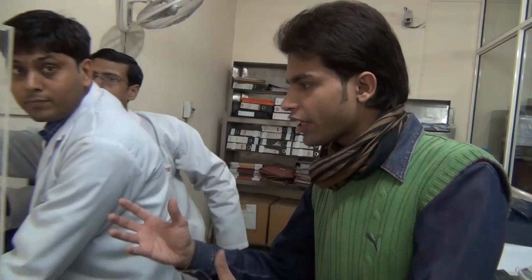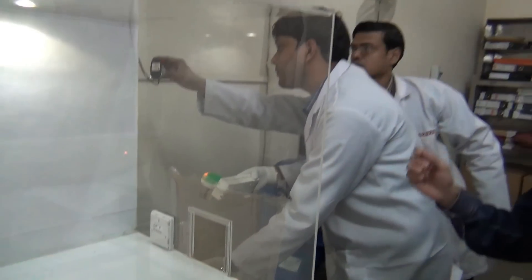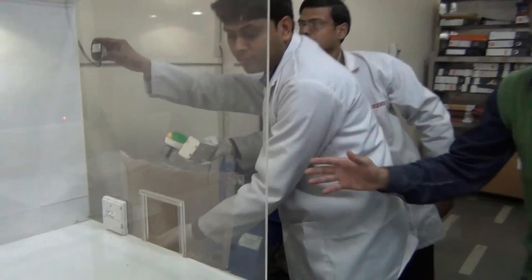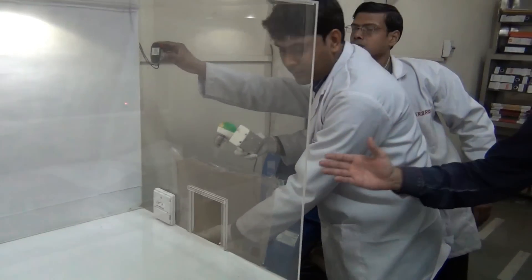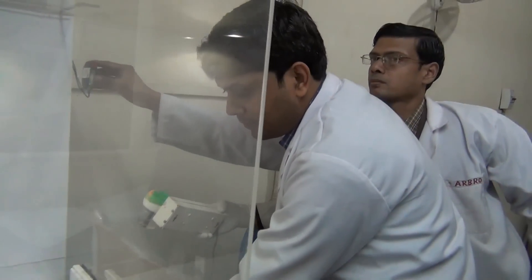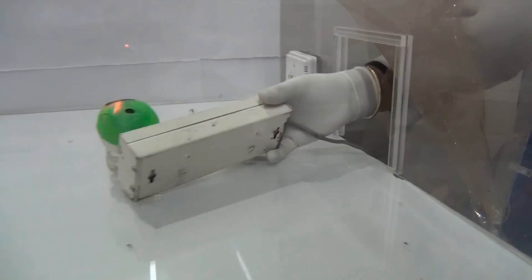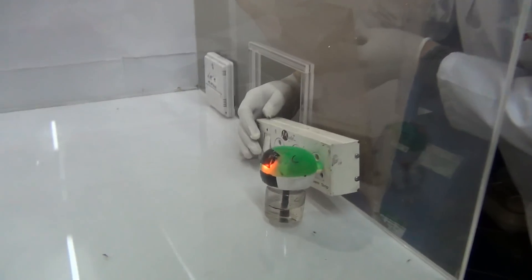This brand is safe. Now we have reached our final stage, in which we will put our machine into the chamber. We will start the timer — we will set it for 20 minutes. The lab assistant is placing the repellent into the chamber. The heat element will be delayed by 15 seconds. You can see the lab assistant putting it in. Our mosquito repellent has gone inside, and the lab assistant has blocked the window again.